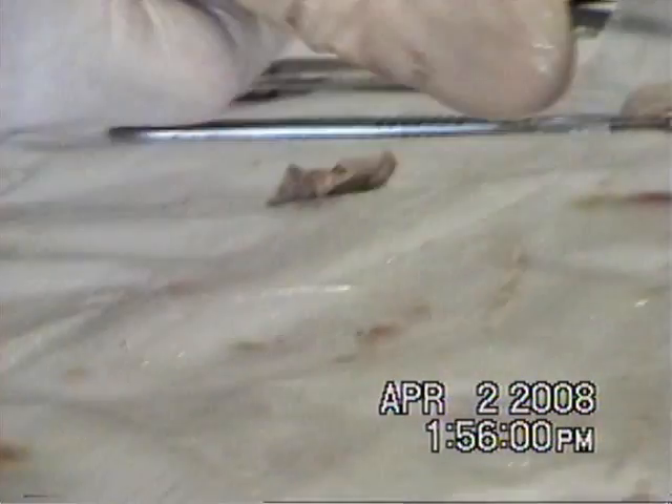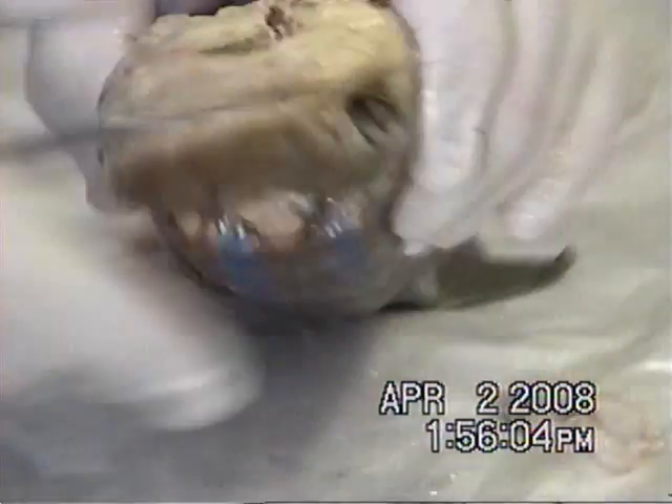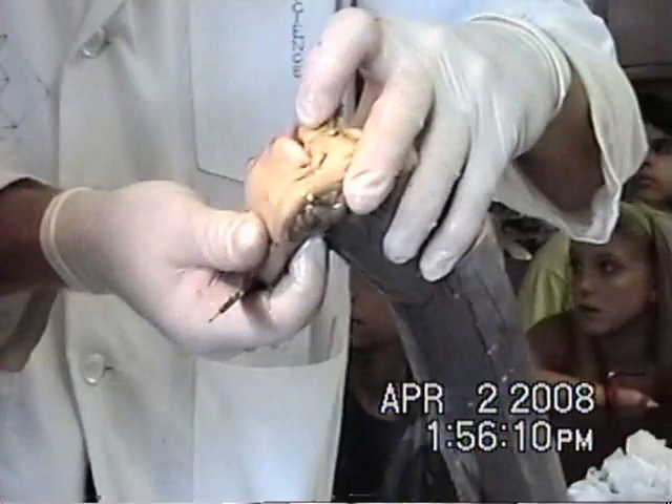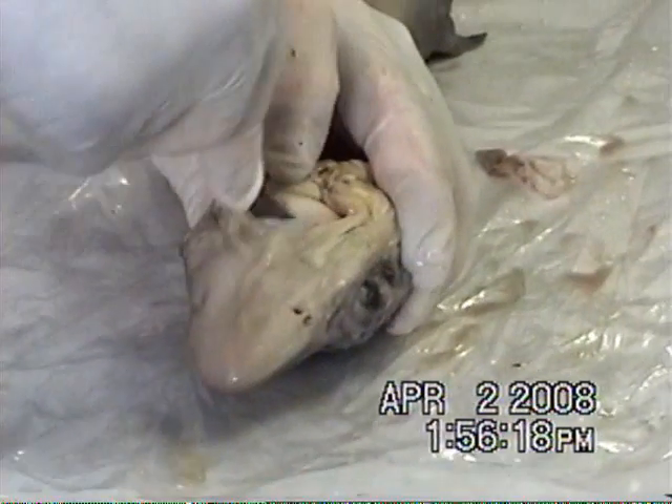The upper jaw — that's solid. Just crack the jaw open. Teeth. Is there a jaw bone in there? Look at its mouth. Yes, you can see the teeth right there. They're like little baby teeth. Yes, there is a jaw cartilage.